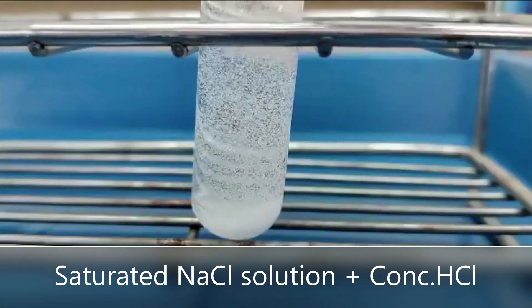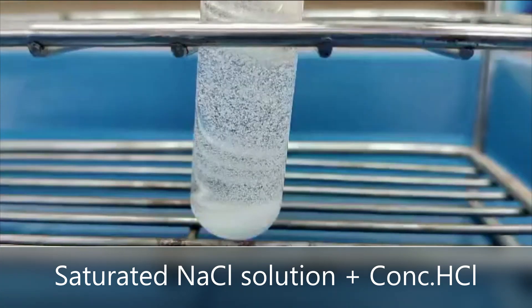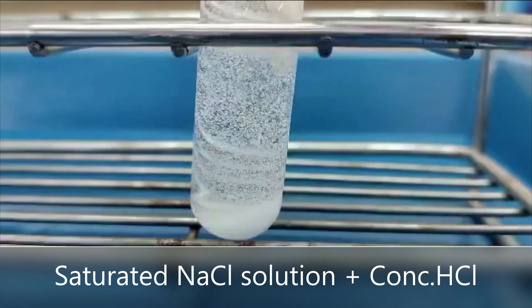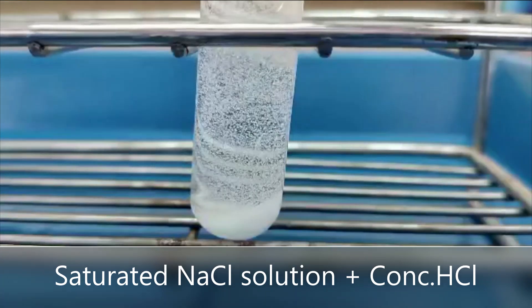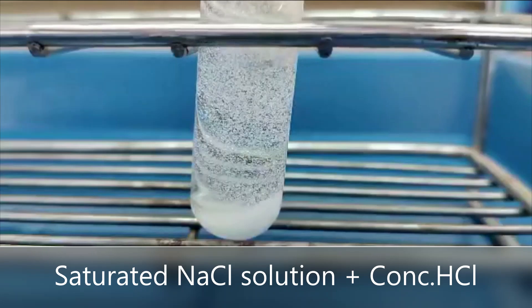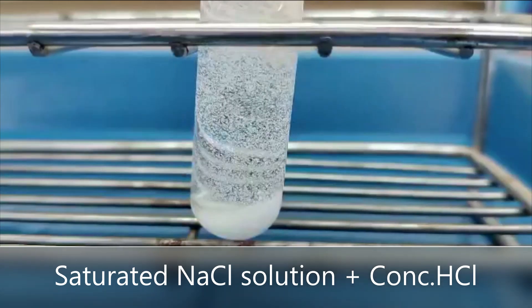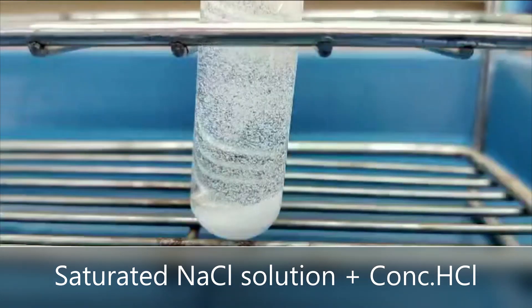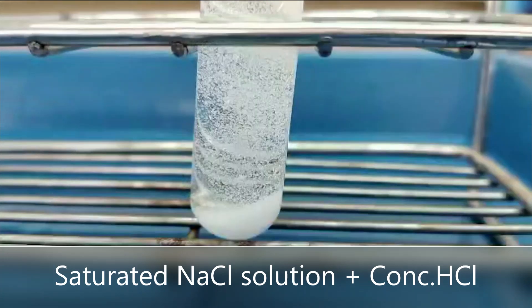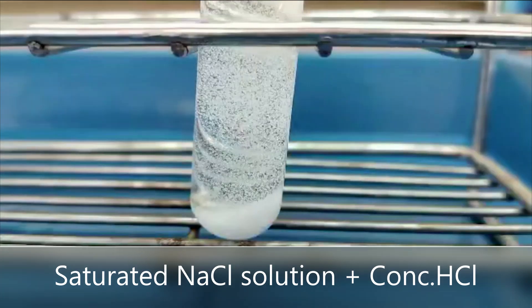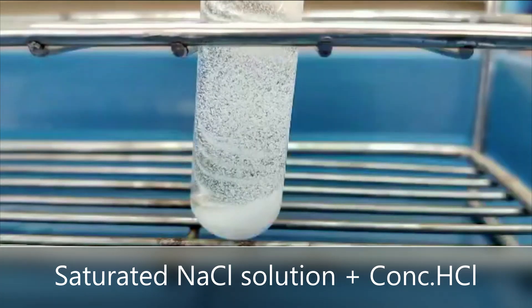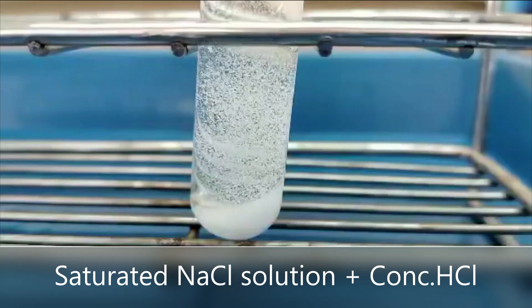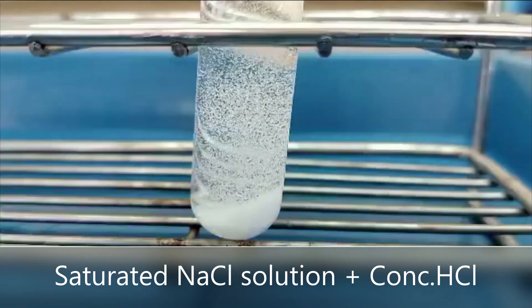We will explain it to you. Hydrochloric acid is partially water-based and may increase the volume of the solution. However, concentrated hydrochloric acid has a concentration of 12 molars. This means that the concentration of chloride ions is also equal to 12 molars.